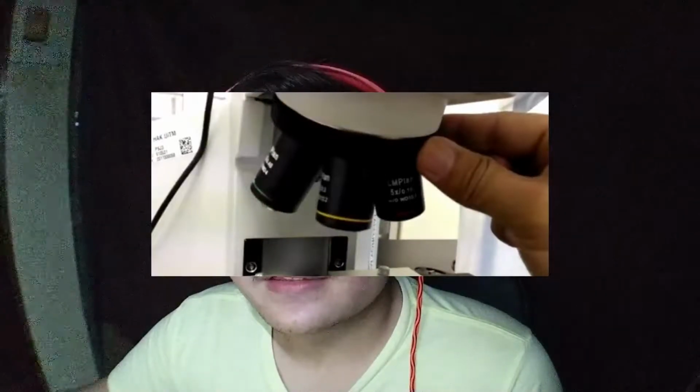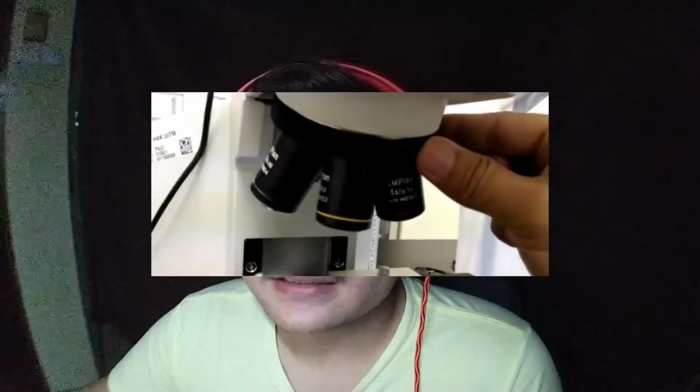Rotate the magnification lens to zoom in and zoom out. But do not hold the magnification lens body. Instead, use the magnification lens holder to rotate. Lastly, continue observation with all other samples and switch off the microscope and computer after finishing.